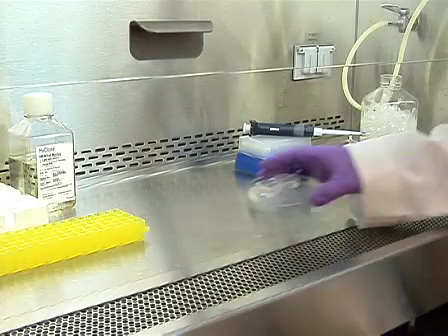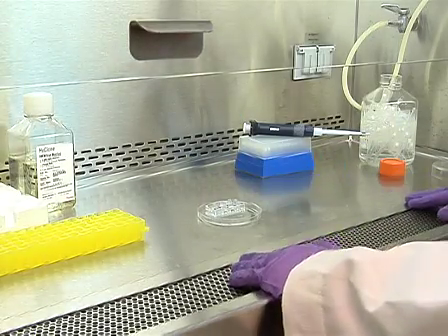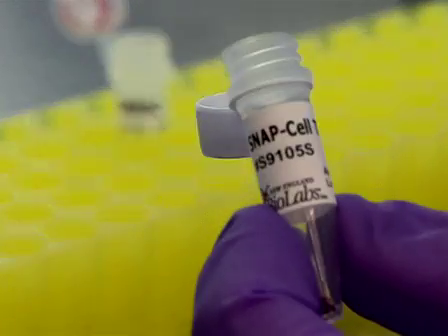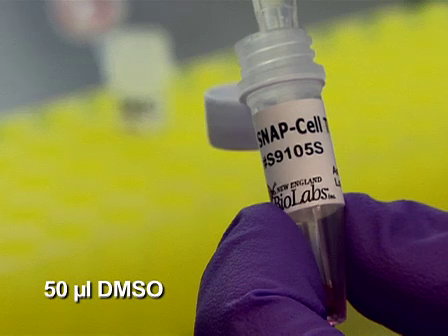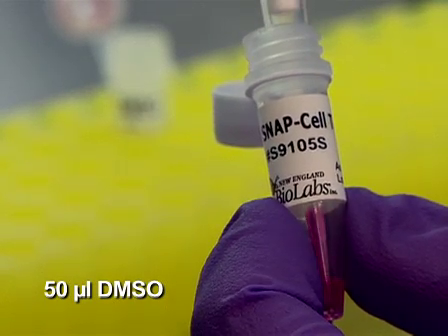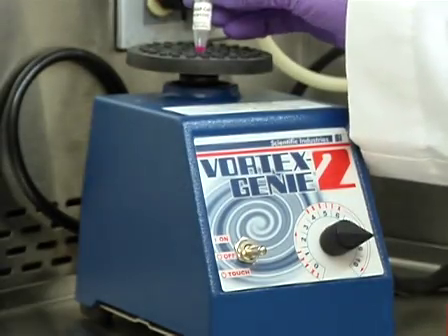The next day, the transfected COS7 cells can be labeled with the SNAPCELL TMR-star substrate. To begin this procedure, add 50 microliters of DMSO to the SNAPCELL TMR-star substrate and pipet up and down. Mix by vortexing for one minute.